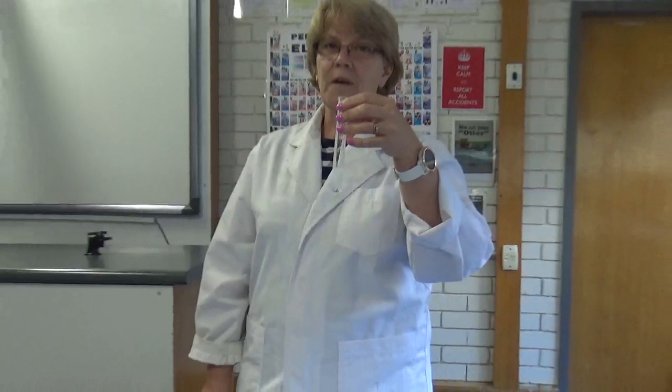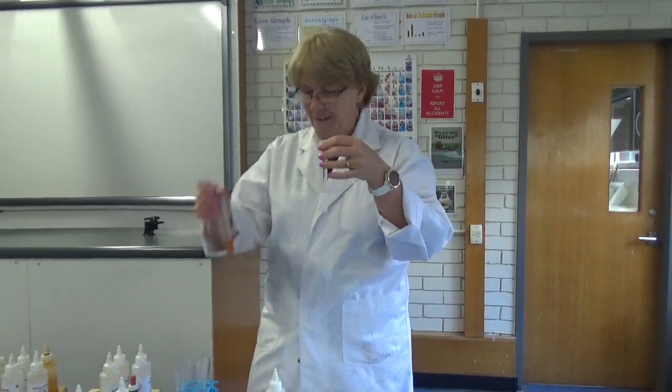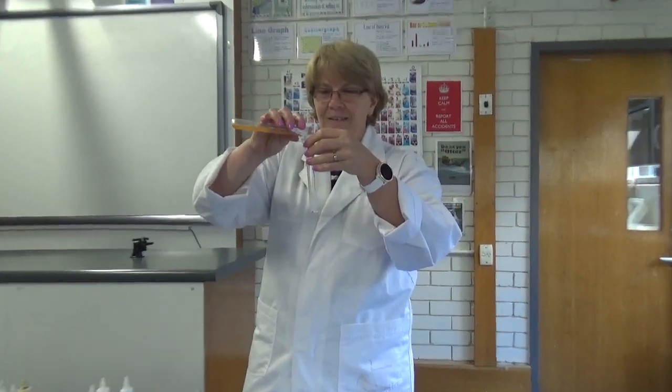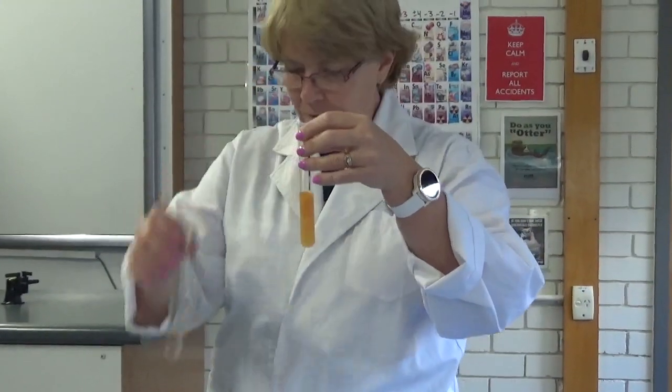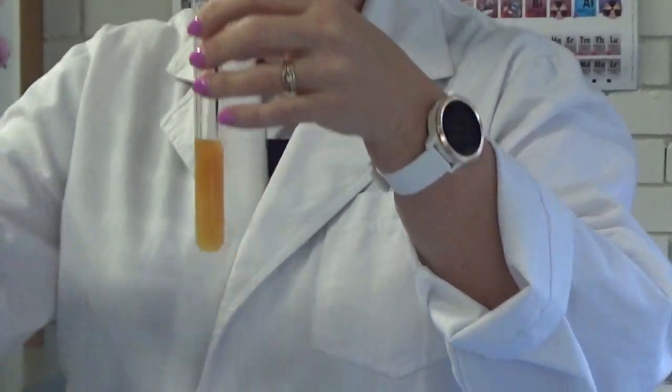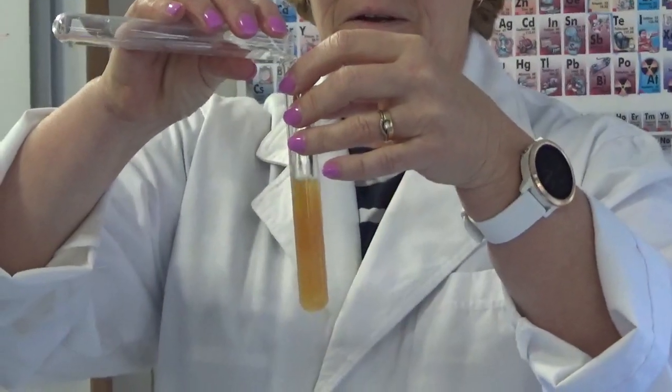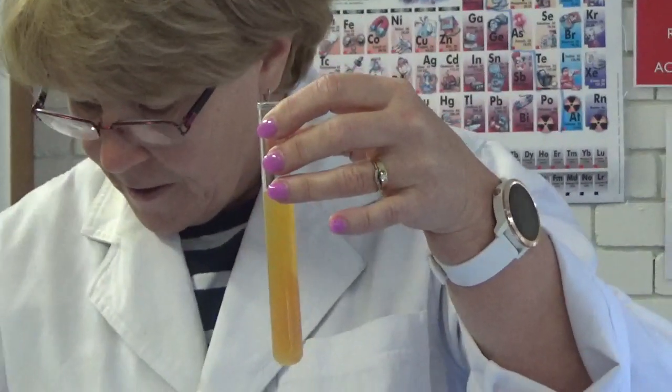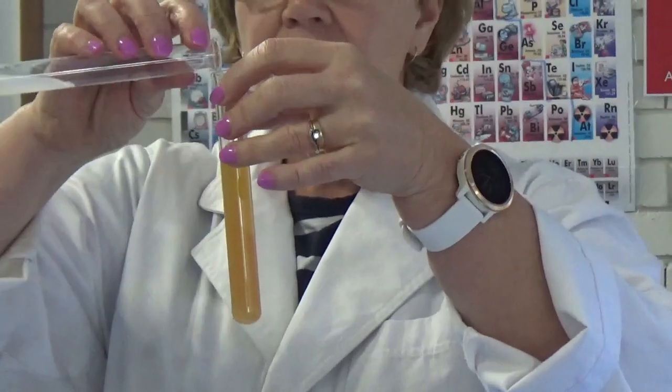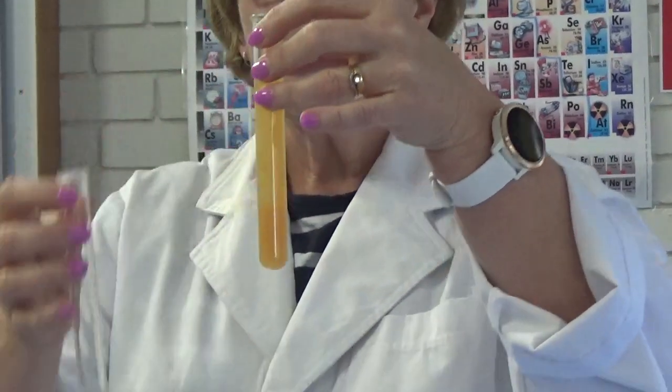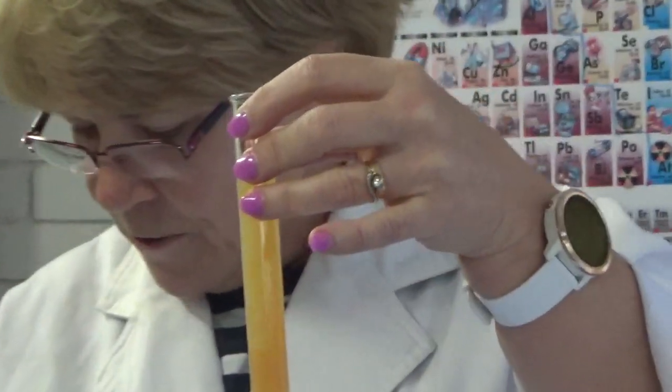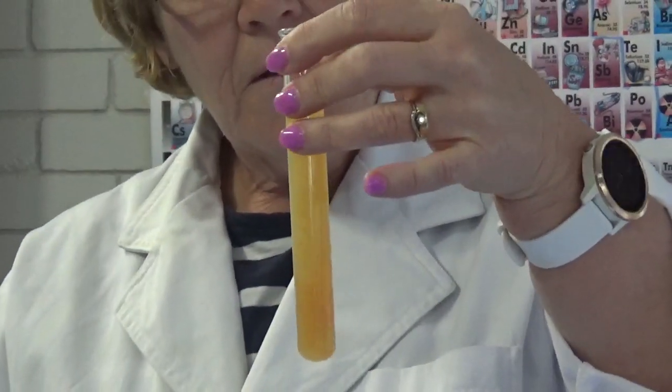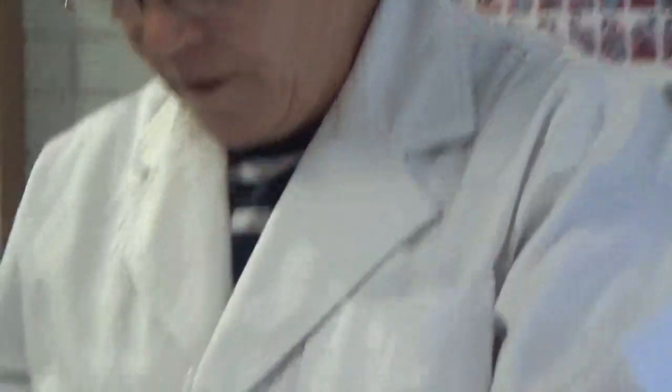Now, I know what you're all thinking. What happens if you put them all together? Let's try it. Oh, that just made it a bit lighter. What if we put this one in? Oh, that seemed to clear it up a little bit. This one. Oh, we're getting that white through there. I think that'll do.